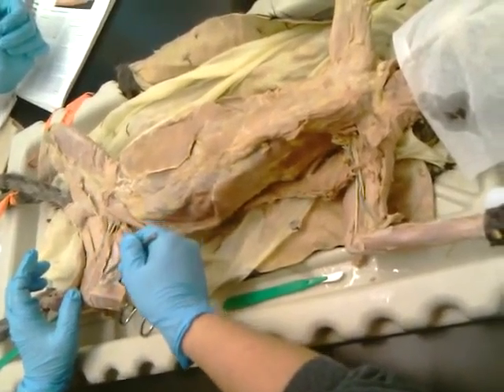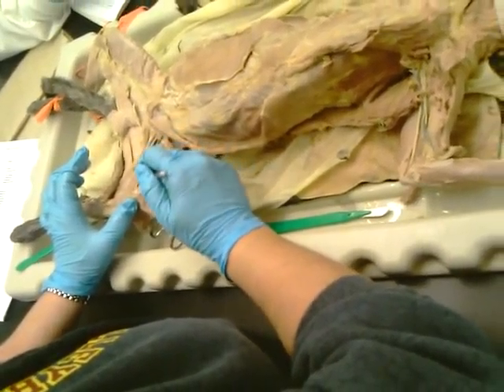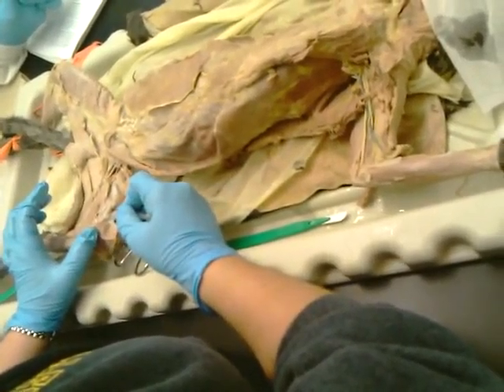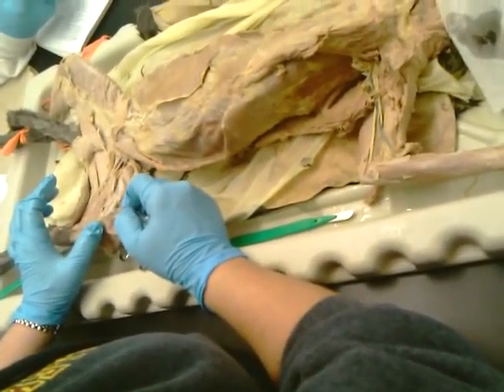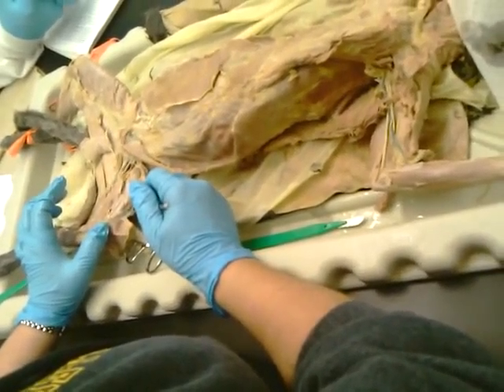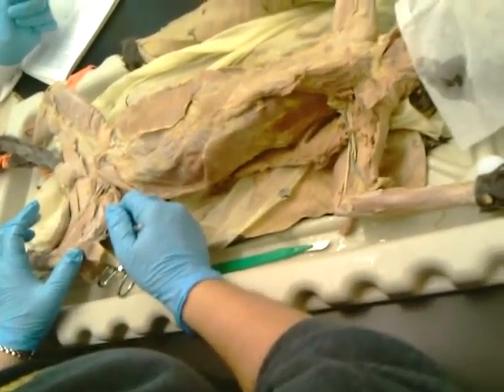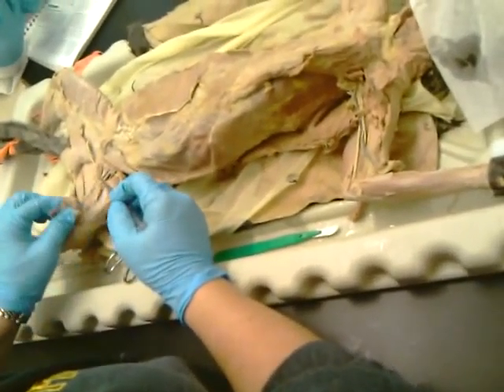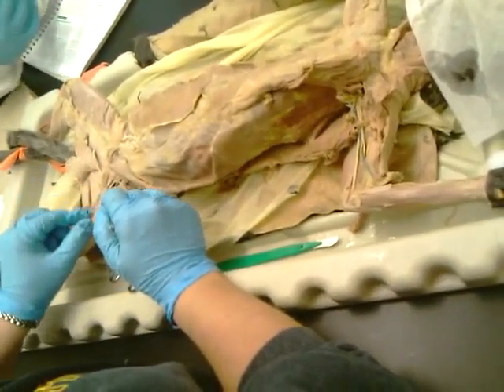Okay. What would this one be? It's on the top part now. Vastus medialis. That would be the one in the middle on the top. Use your best. That's on the front. We're making up muscles now. Rectus femoris. Okay. So we have vastus medialis, we're going to have the vastus lateralis out here, and then the one in the middle is the rectus femoris.